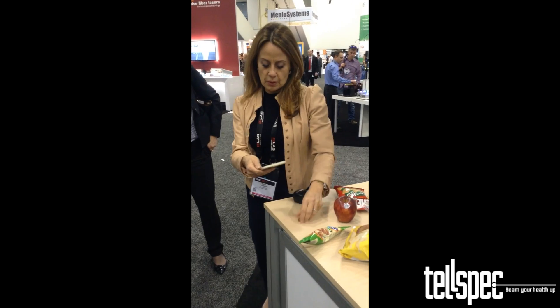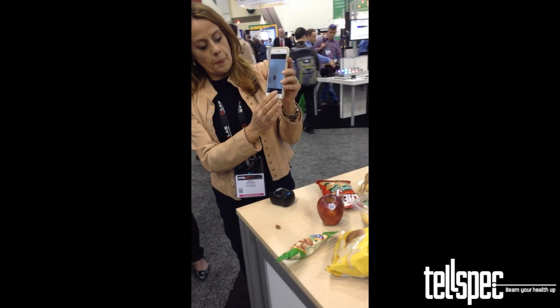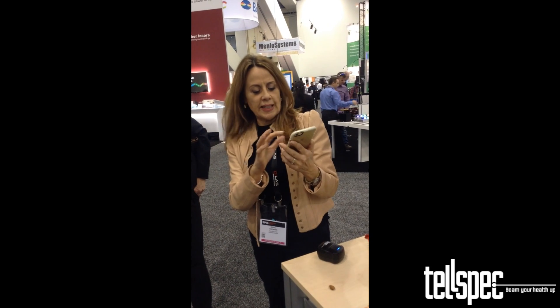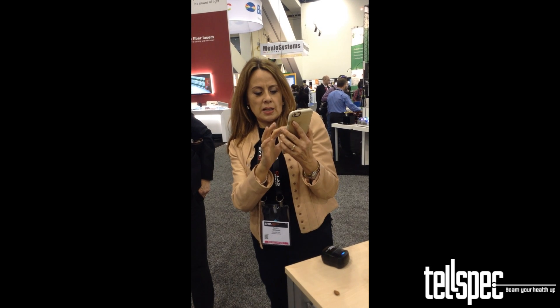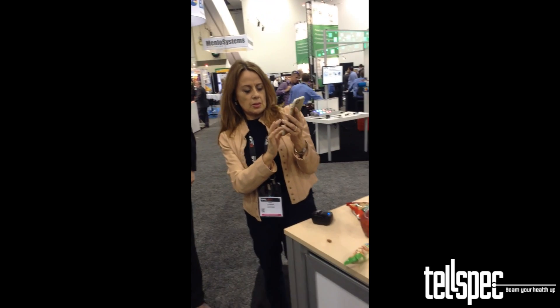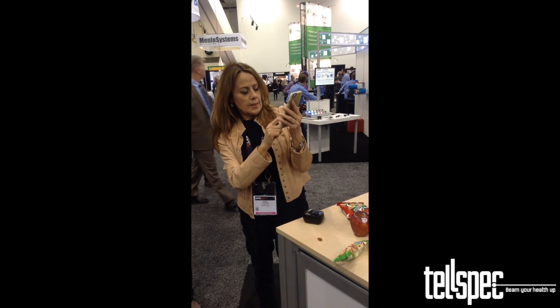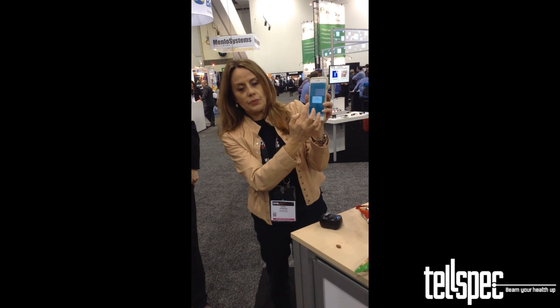I could take a photograph, so I'm going to take a photograph of these almonds and use that photo. Now I have a photo assigned to the scan. Now I'm going to assign that food to a meal — say it's a snack, my number two snack. I'm writing 'almond,' and I'm going to enter the amount I'm going to eat: 120 grams of that almond. It's successfully assigned.